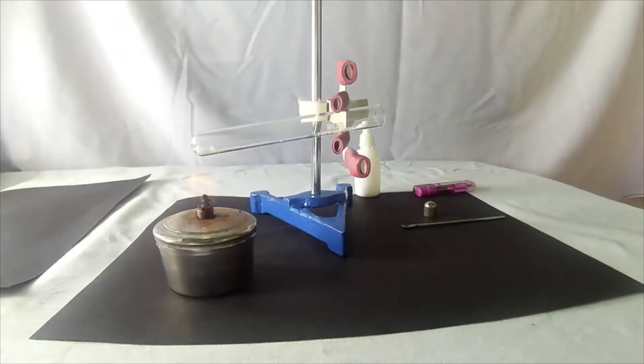Now we can hear the cracking sound. Lead nitrate decomposes with the sound. This is called decrepitation. Listen carefully.